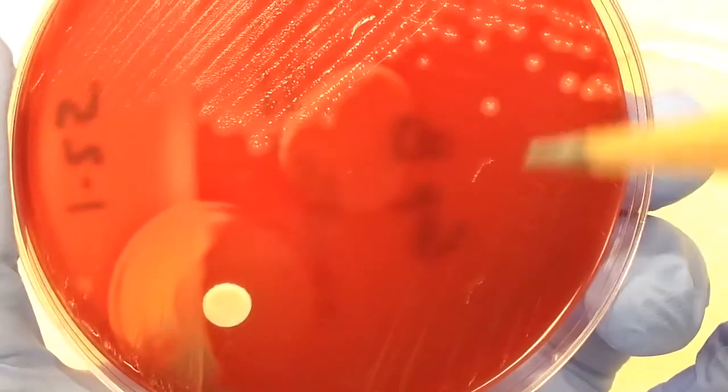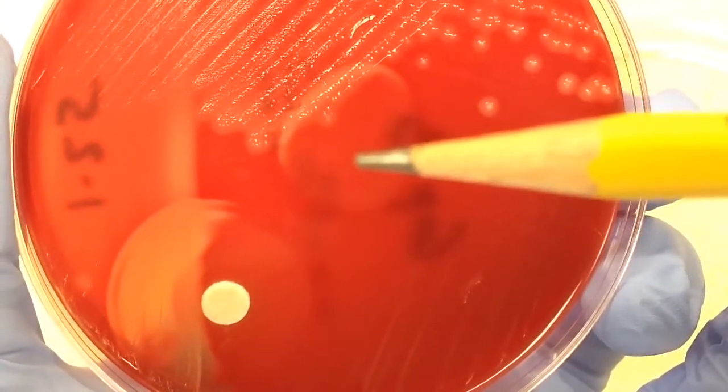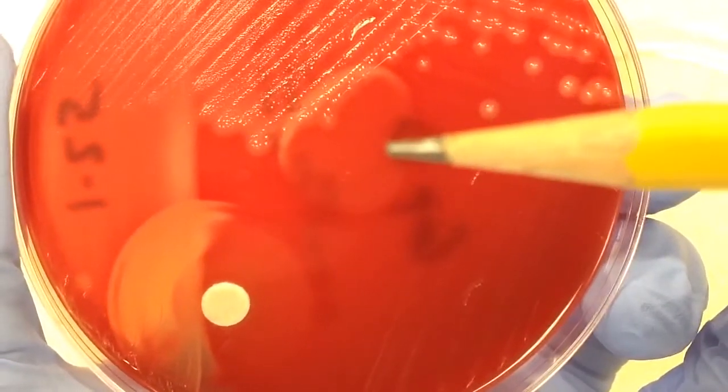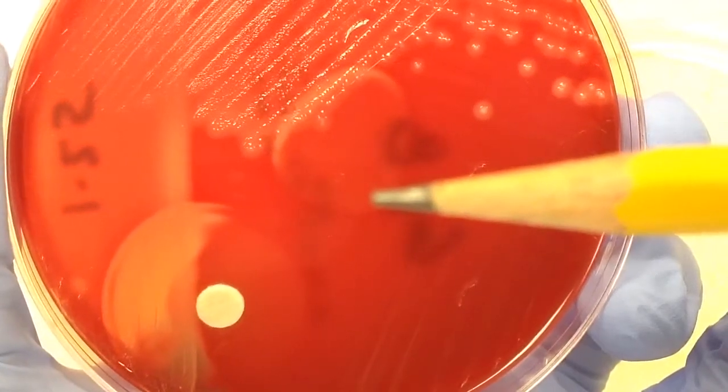Now what I've done here, what's happened here, is we also have a CAMP reagent, which is liquid. And I went ahead and put a couple drops of this on, and then put it in the incubator.